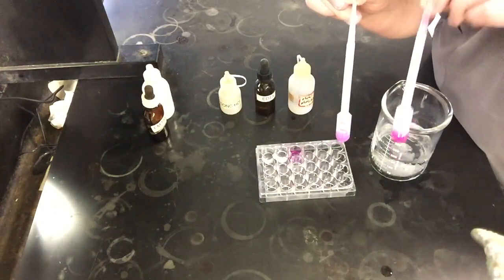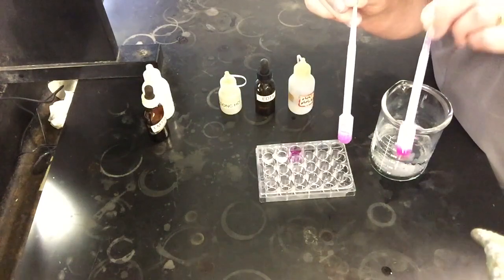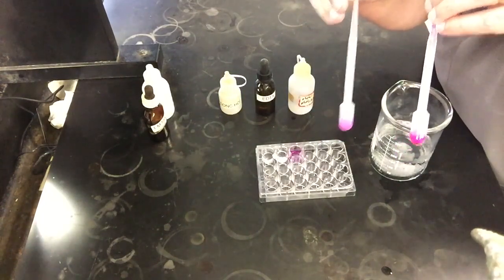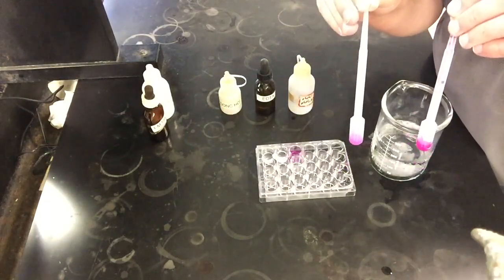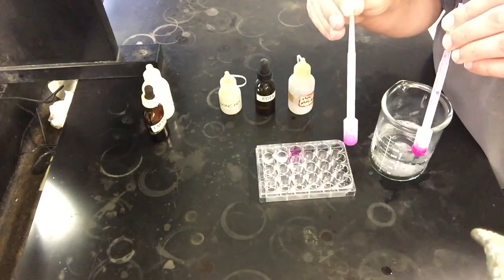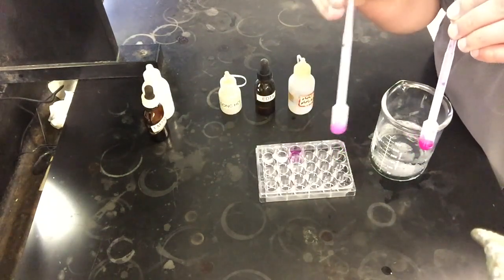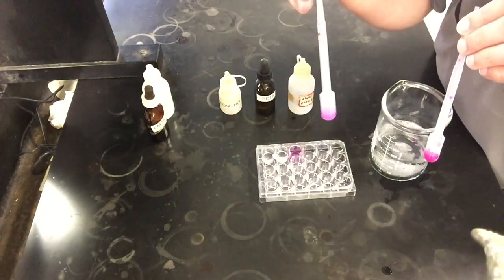The one that's the colder temperature, the one that's just been sitting in this ice bath right here, is a darker color. That means there's more hydroxide in that solution. That's what that visual indicator in these solutions is helping to tell us. And so you want to use that to help figure out which way your reaction is going. Right? Hydroxide's a product, so you can use the colors to figure out if this is less hydroxide. That's telling you whether you have more product or less product.